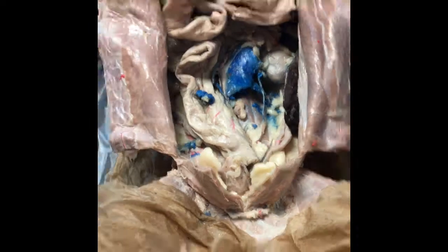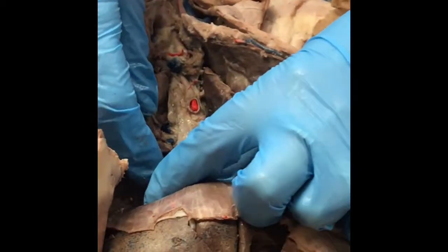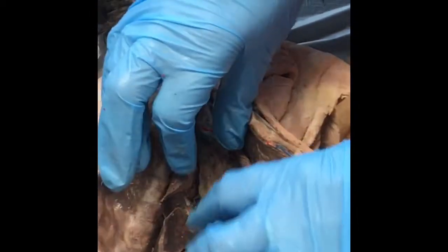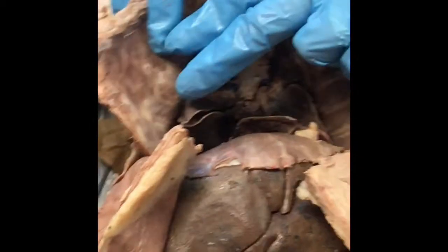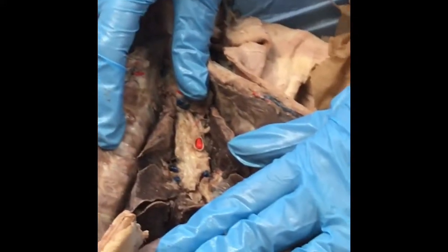Okay, go ahead. These are going to be your lungs, okay, and where everyone's like, where are all of these lobes? Well, there was one deep to the heart. You really couldn't see it when the heart was in there. Do I want to know all of the names of the lobes of the lungs? No, just that they're lungs, okay? So you have all of these here on the right and the left. Again, will I have this as an actual pin structure? No. But you guys had to cut a section of the lung off, right? What were the 3 things that you had to find inside that section of the lung?